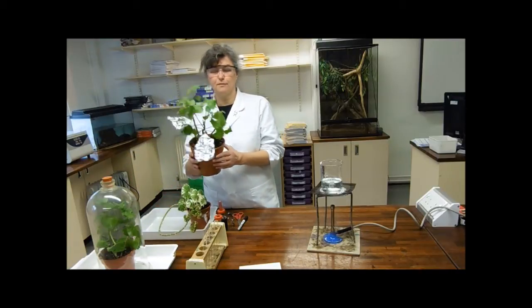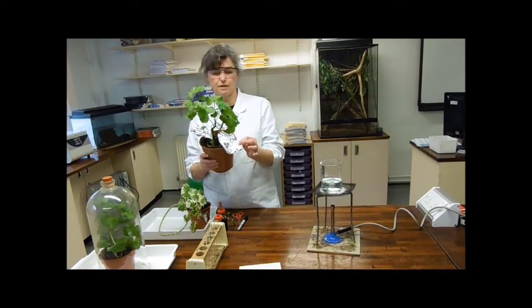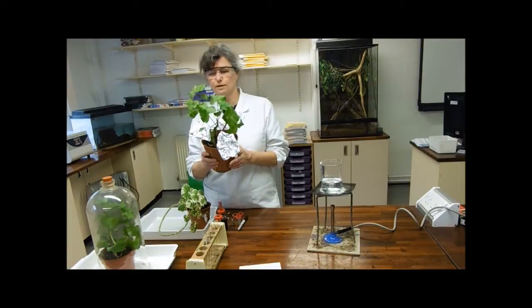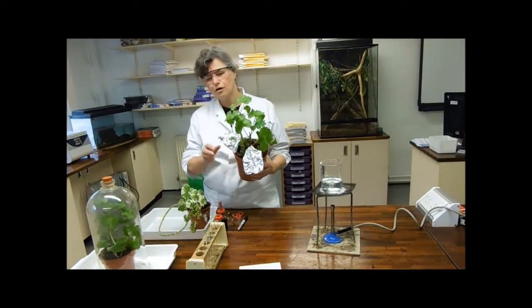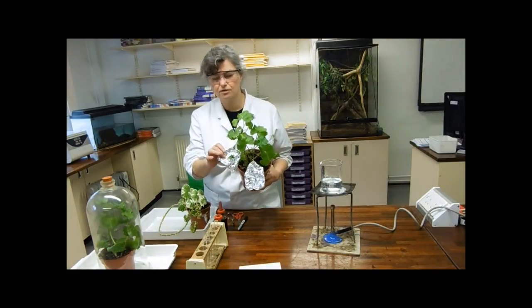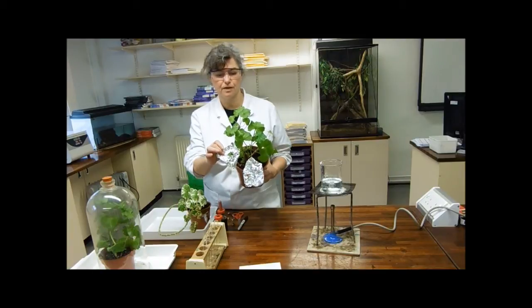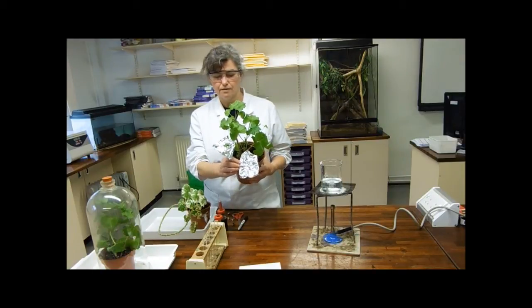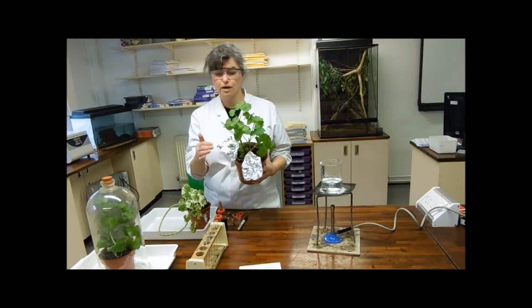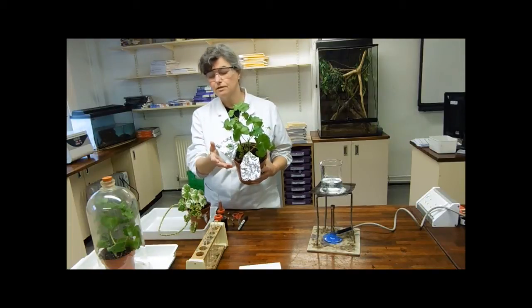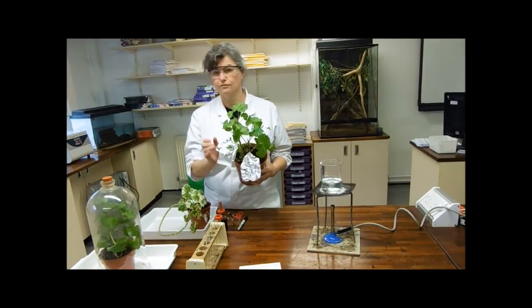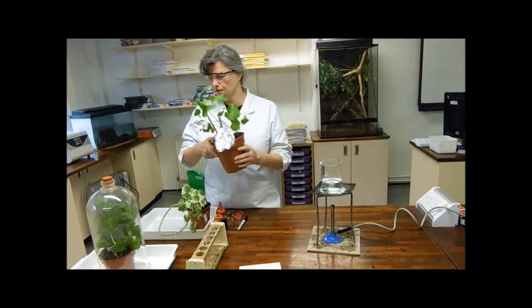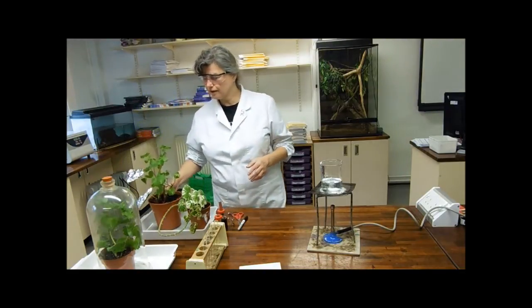I've got a plant where one of the leaves has been deprived of light for 24 hours and one where lovely Amanda has cut out a pretty little star. This is going to show us the requirement for light. If it needs light, we should only have photosynthesis where the star has been cut out.